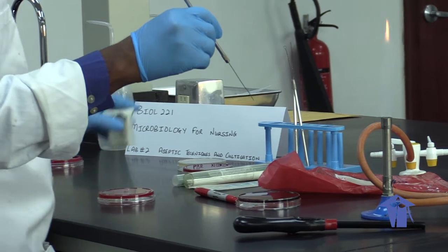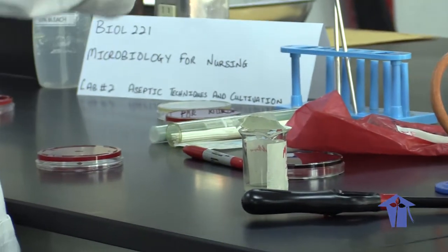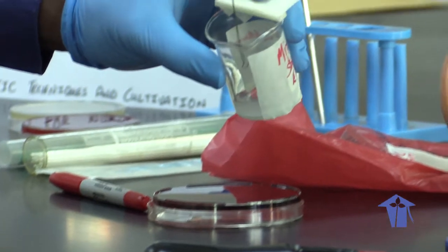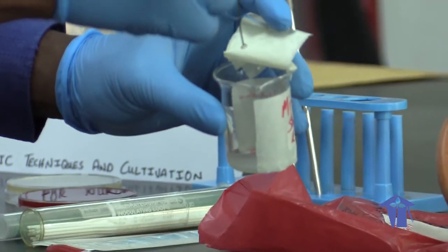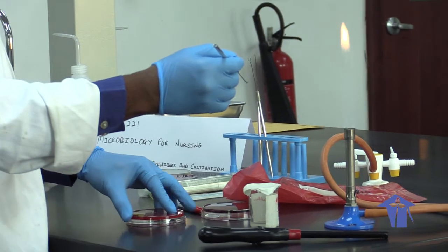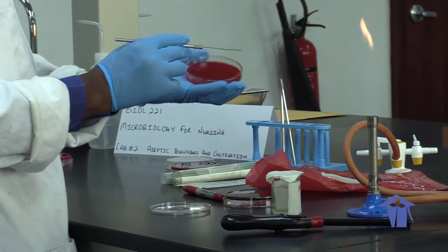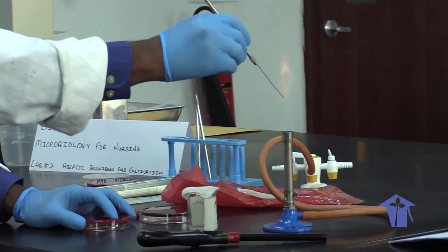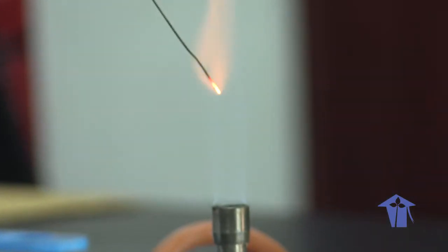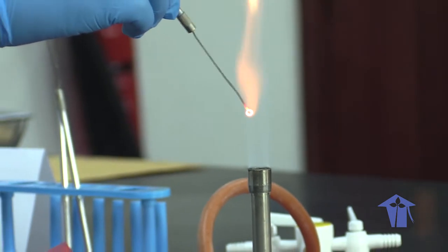Once we've achieved that, give the loop a second to cool. Working as close to the flame as possible — I like to think of it as a mushroom cloud where all the air above it is sterilized — working underneath the flame, we have a sterile area. With our cool loop, we go into the broth, take a loopful, and use that as the inoculum on our clean blood agar plate. Holding the loop at an angle, we inoculate just one corner of the plate. I keep a finger where I inoculated the plate just to mentally remind myself of where I have inoculated.